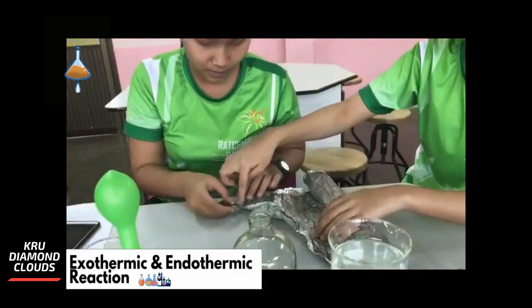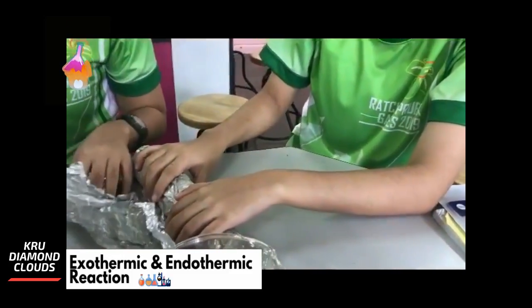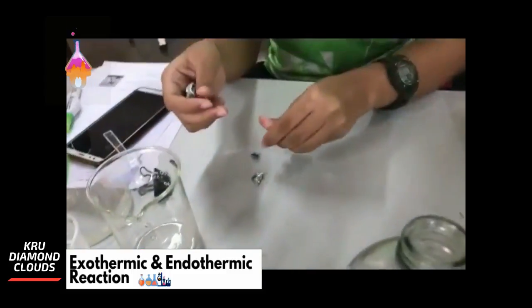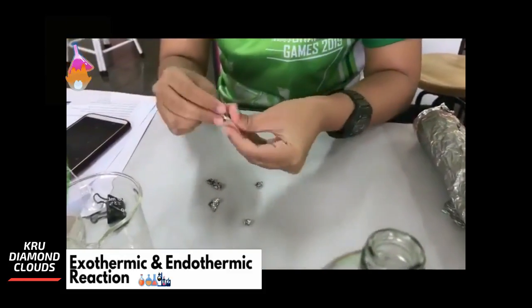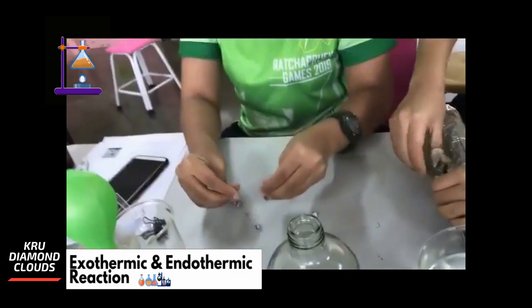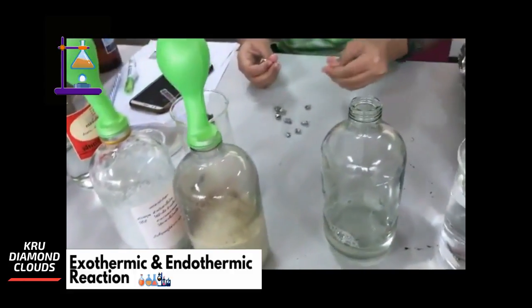Now cut the aluminum foil into smaller pieces — like this, just make them small. When we put the aluminum foil into the acid it will start to decompose, and when it decomposes it will produce hydrogen gas.